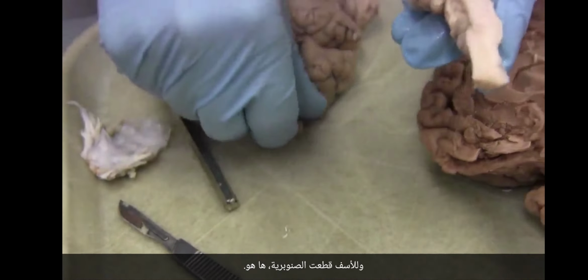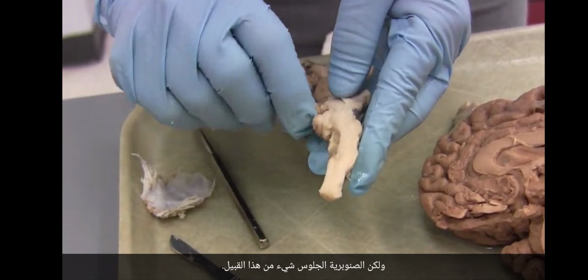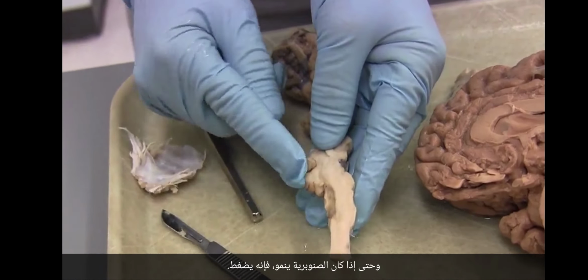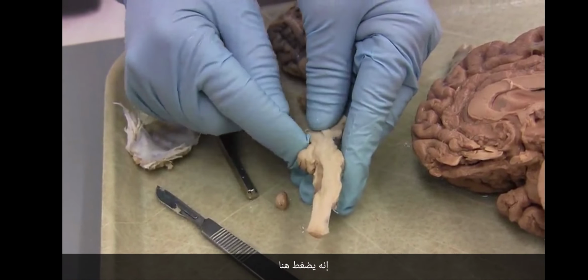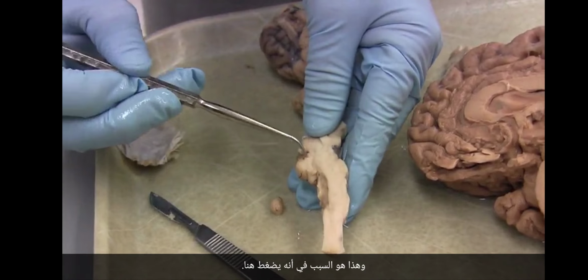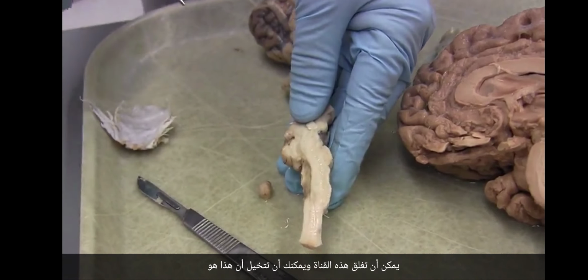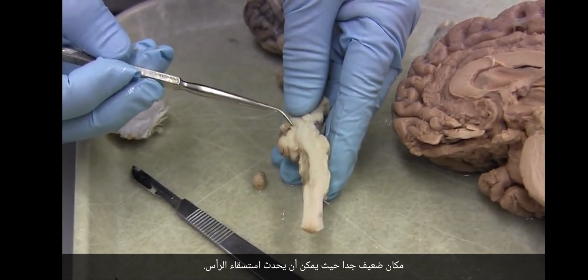And regrettably, I cut off the pineal. There it is. But the pineal would sit something like that. And so if the pineal grows, it presses right here. It can close this aqueduct, and you can imagine that that is a very vulnerable place where hydrocephalus could occur.